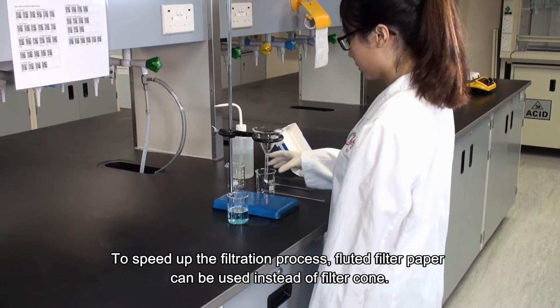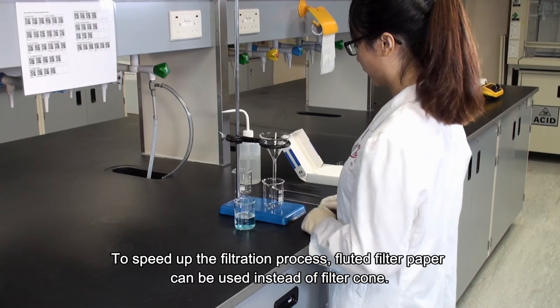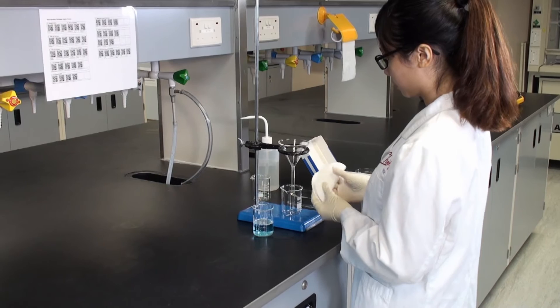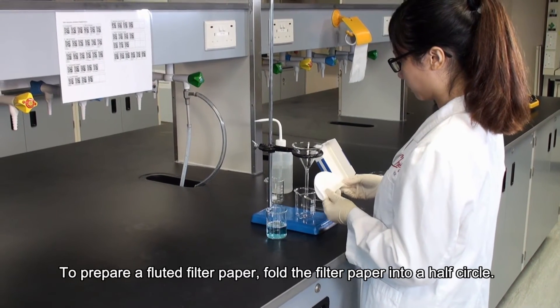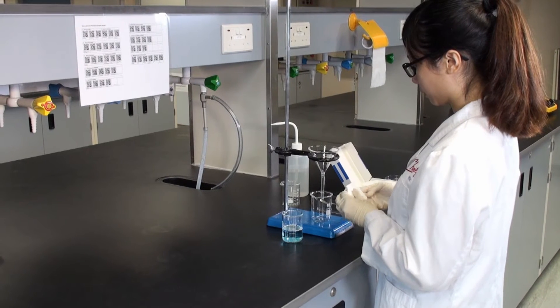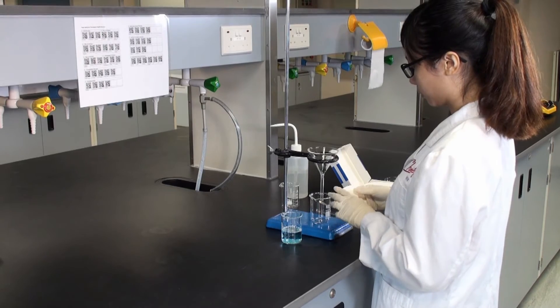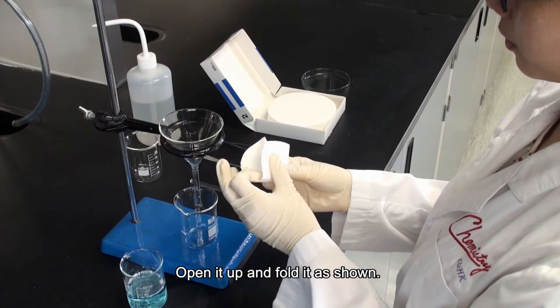To speed up the filtration process, fluted filter paper can be used instead of a filter cone. To prepare a fluted filter paper, fold the filter paper into a half circle, then fold it again into a quarter circle. Open it up and fold it as shown.